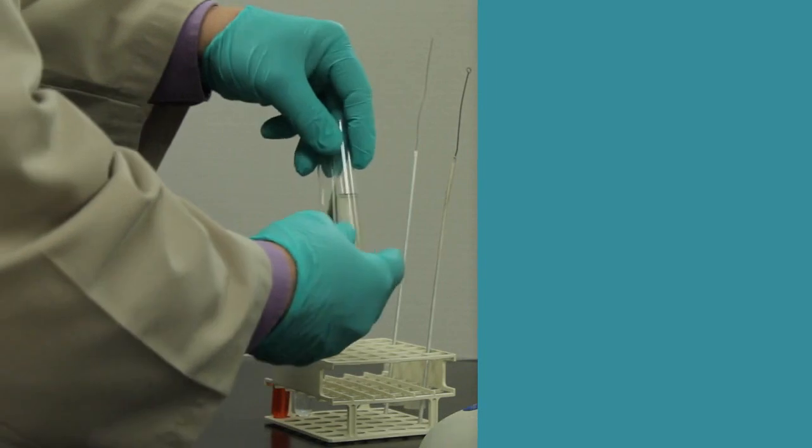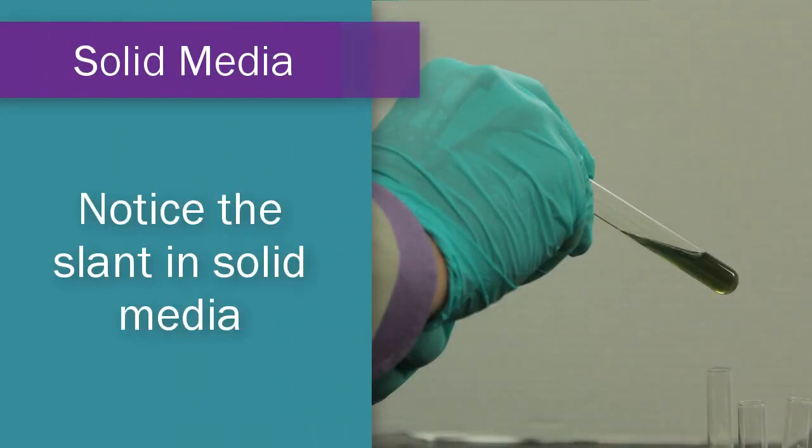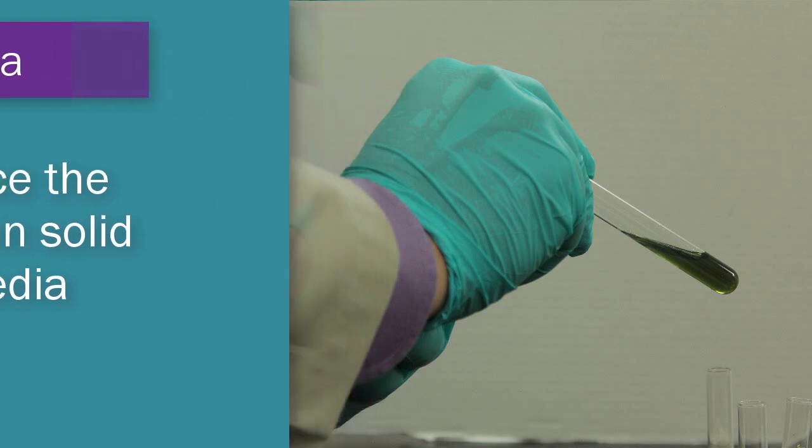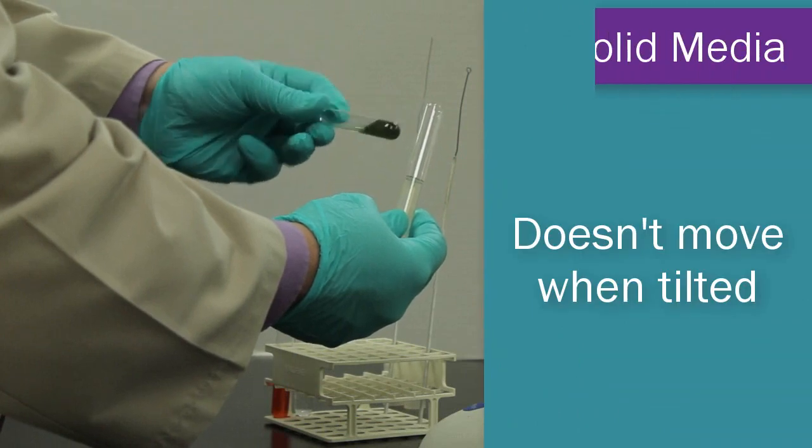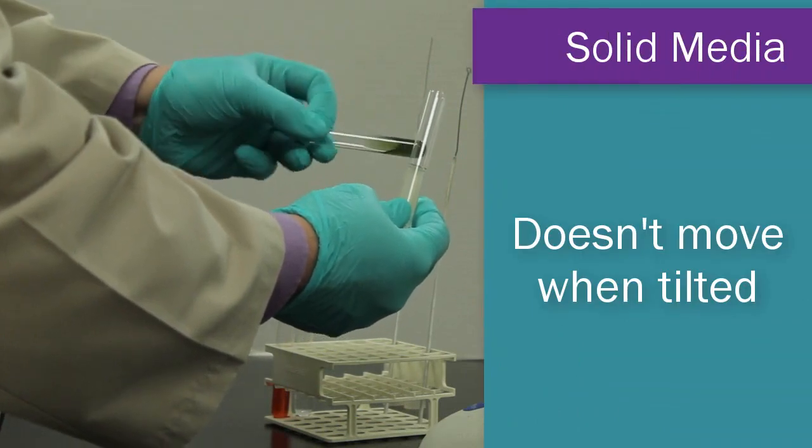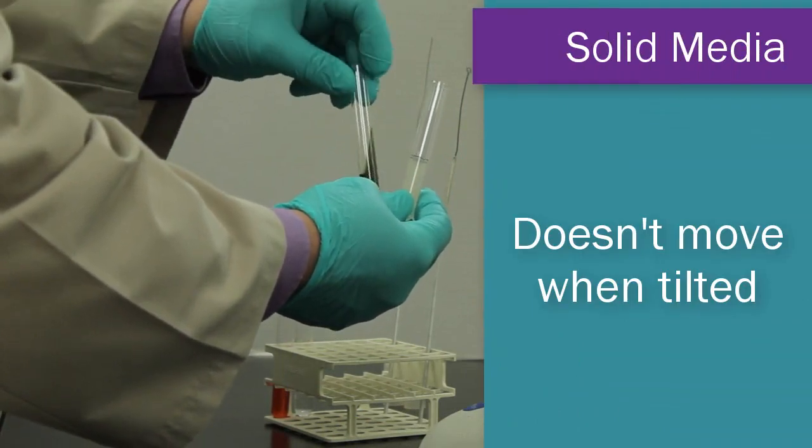The other type of media that you'll be using is a solid media. This one is a solid agar media inside of a tube. Notice the slant, and when I turn the tube sideways, the agar doesn't move at all. It's completely solid.